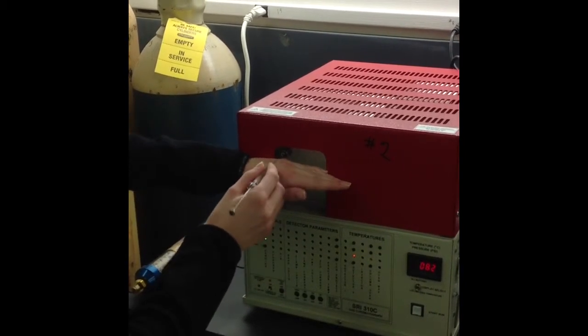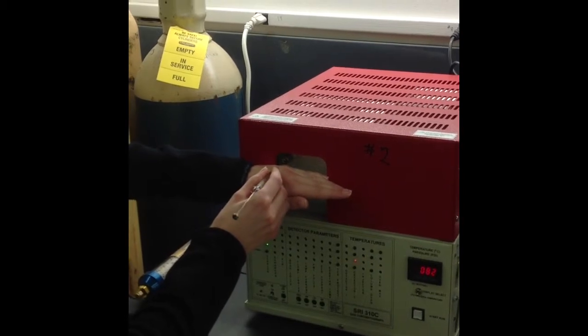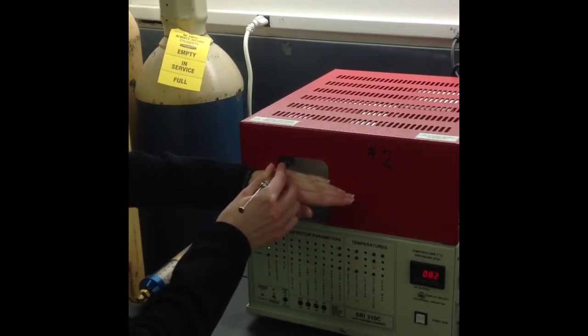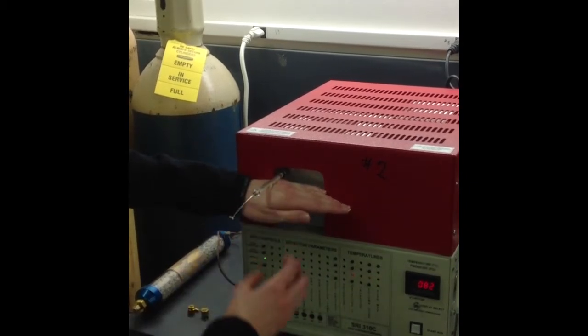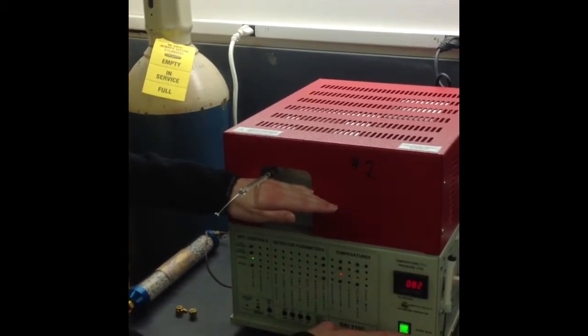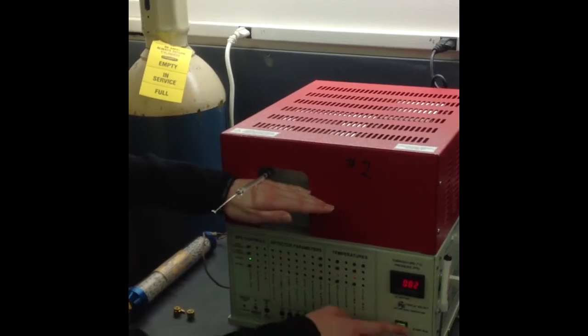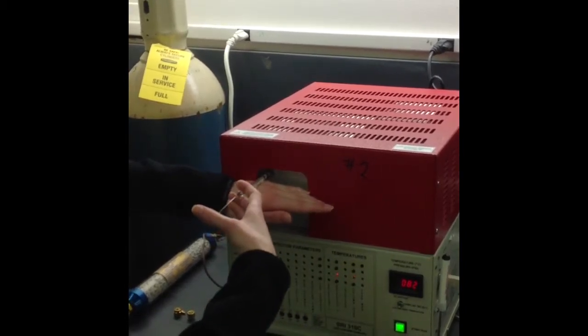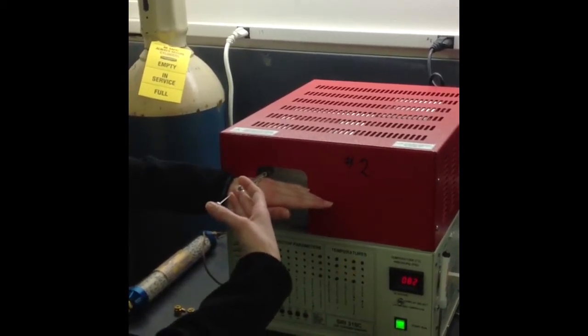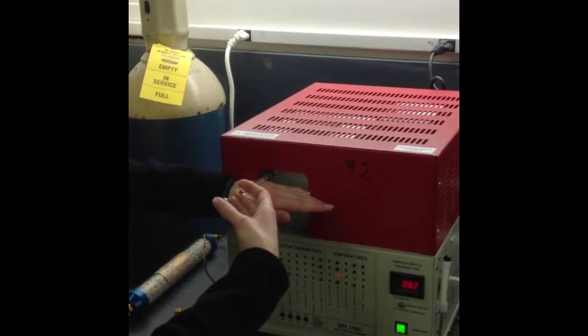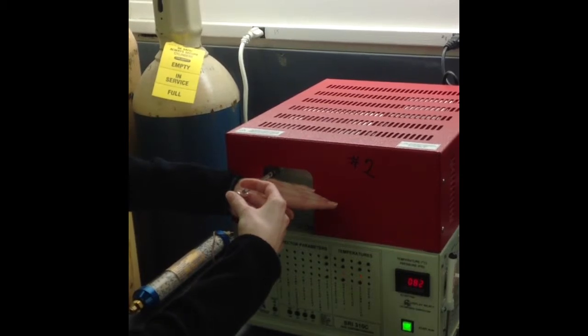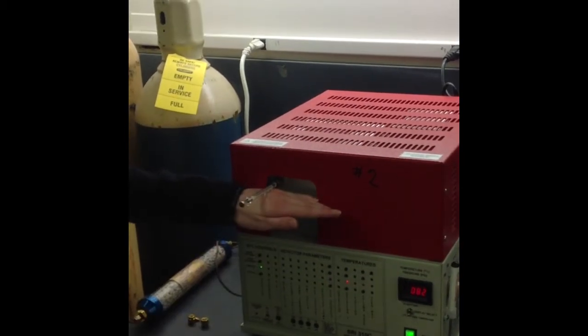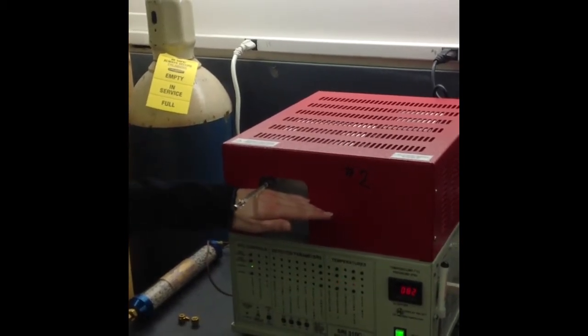And you want to put your hand there so you can brace when you inject the needle, so you can actually stick it in and then it's not hanging. So I can press, you go all the way, and then holding it there, you can actually press start run. And once you do that, then you can inject plunger at a steady pace. And you inject that far, and then you have to leave it there for about 30 seconds to about a minute.